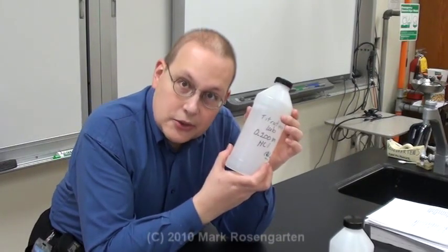Well, neutralize it with an acid whose concentration you know. This is 0.1000 molar HCl, hydrochloric acid. I know because I made it myself. It's good stuff really.